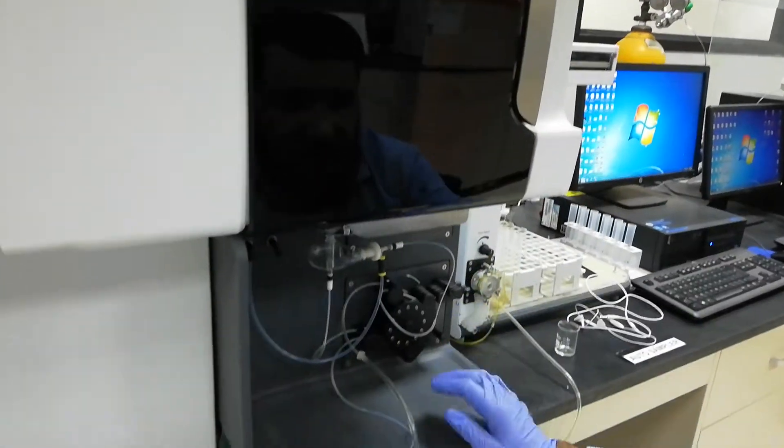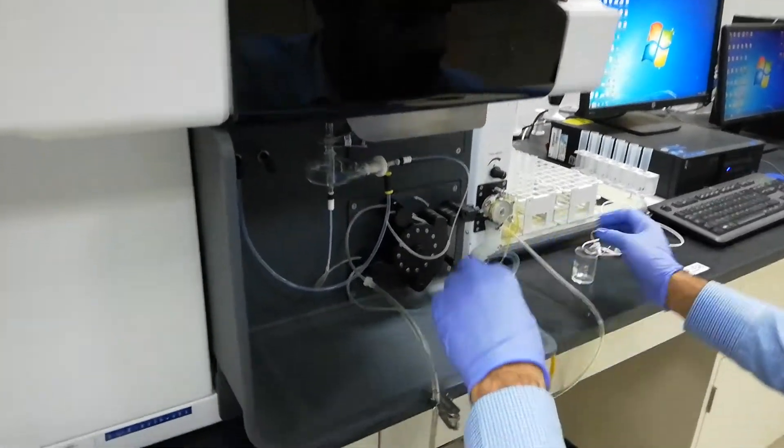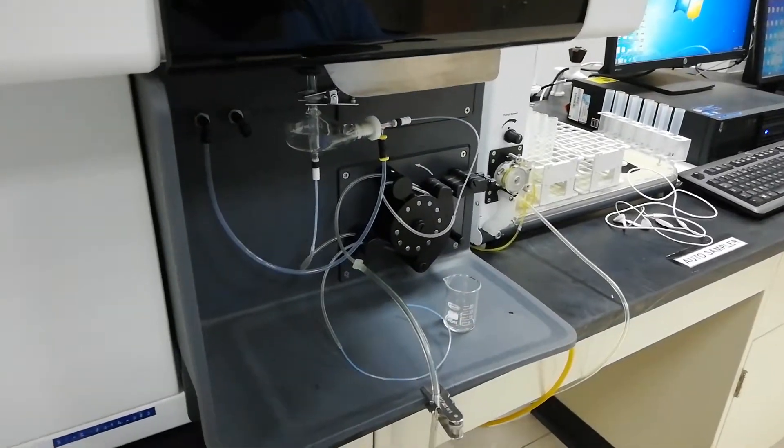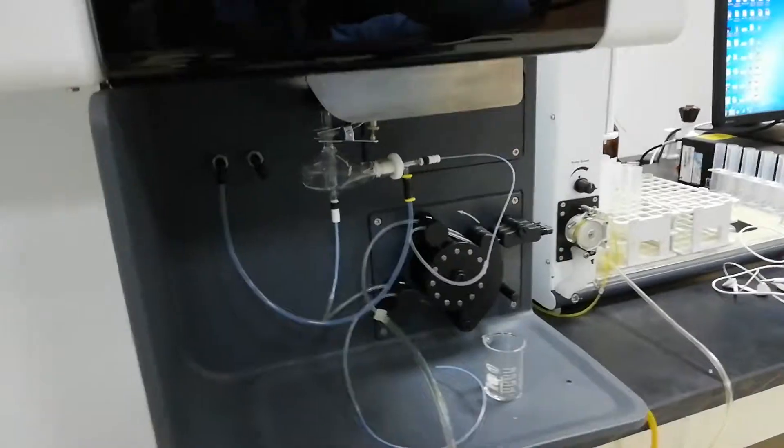So this is the basic main step when you are going to analyze the sample and you have to do like this.